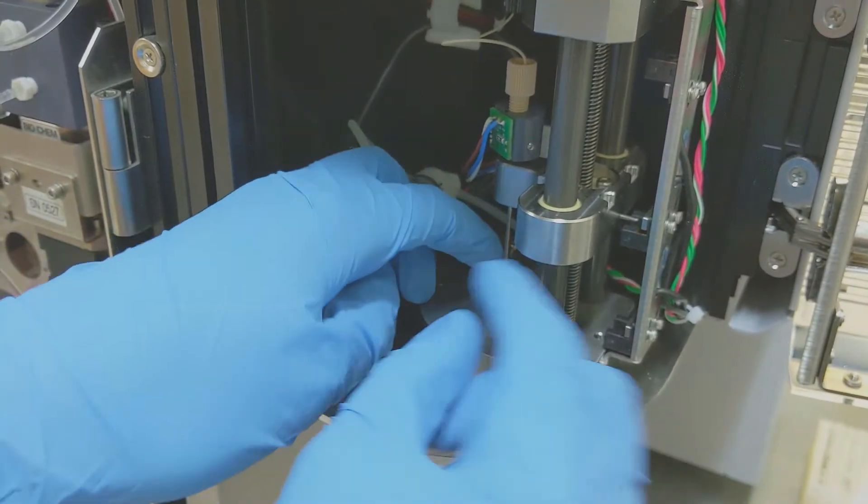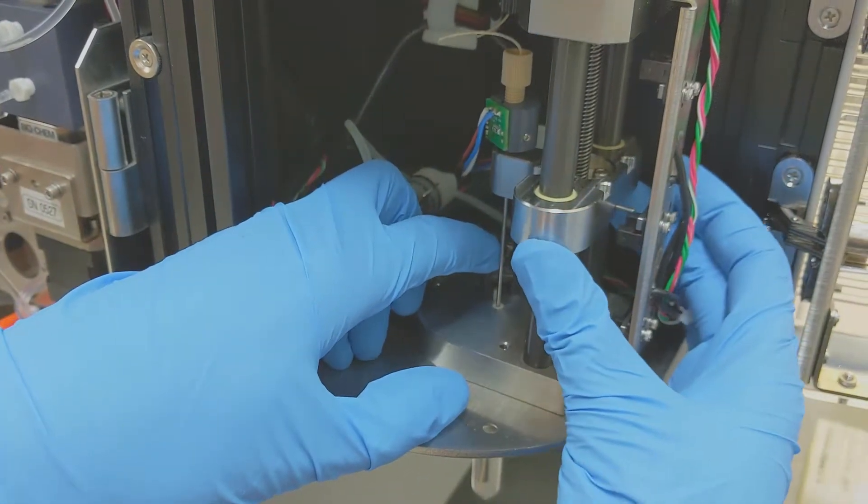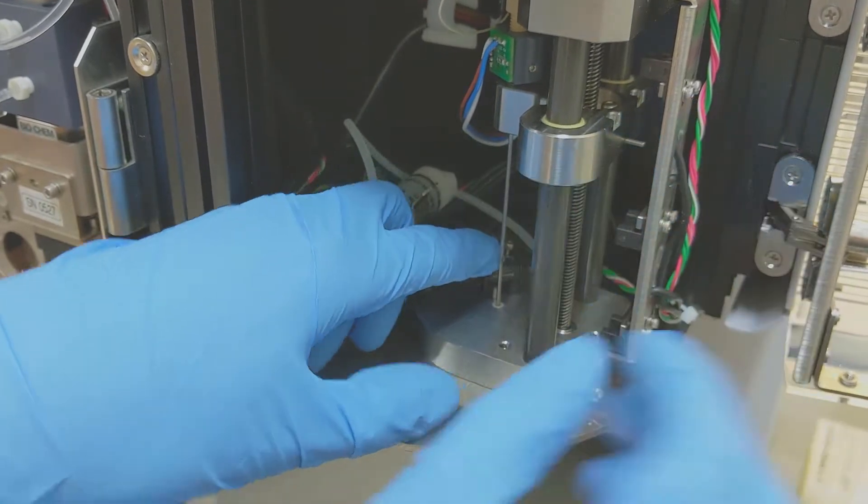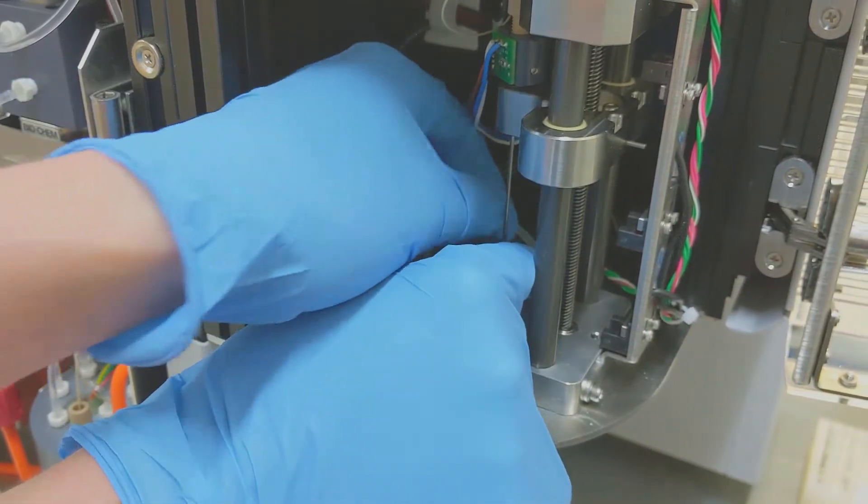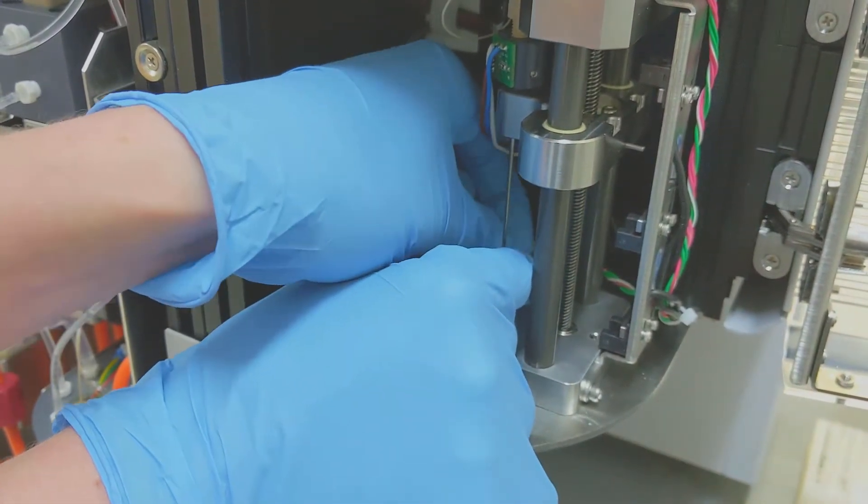There's not a lot of room to work in here so if your instrument is off you can slide the sample line up along the lead screw to give yourself a few more inches of wiggle room.